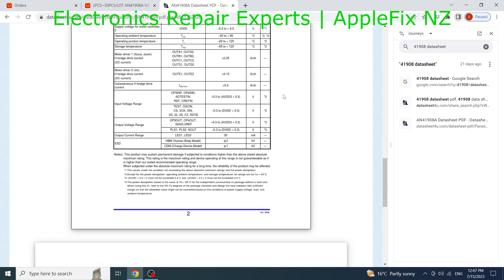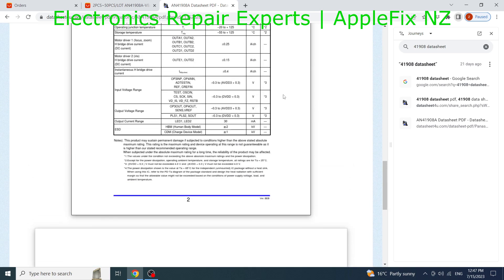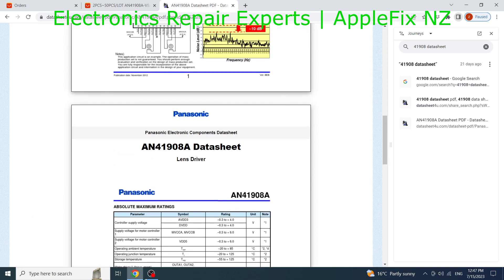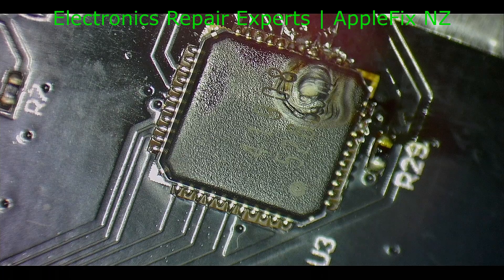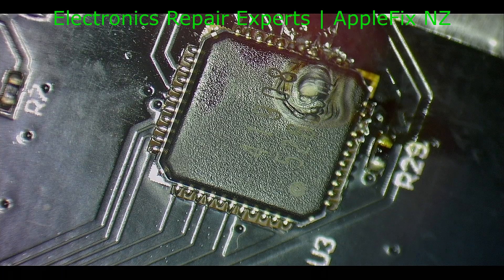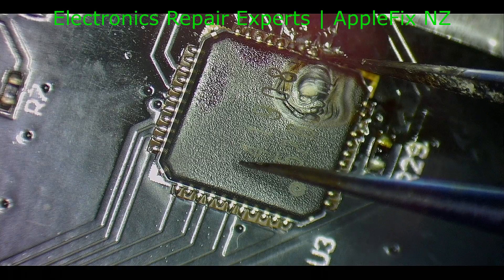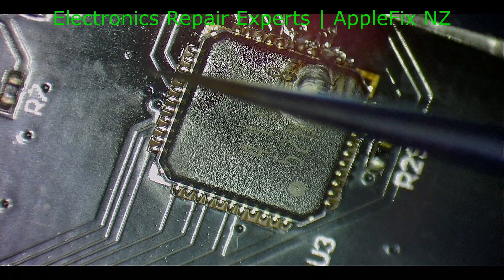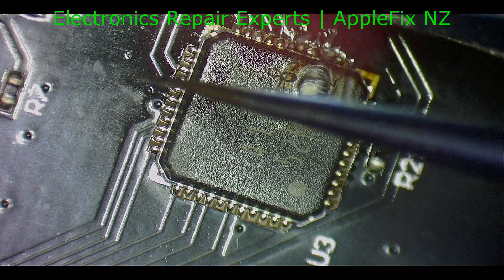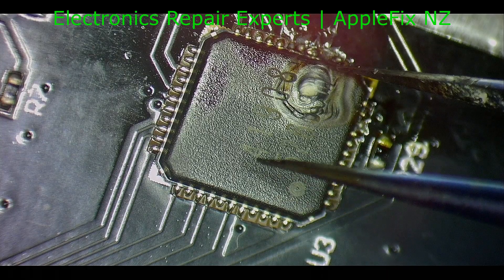It's a lens driver — Panasonic. Does that make sense? Yes, yep. So we know what it is now. Let's remove it. I'm honestly not very positive that it's going to work — do you see these traces? They are all gone. If these were burnt, I know where they are coming from, but anyway, let's remove it.